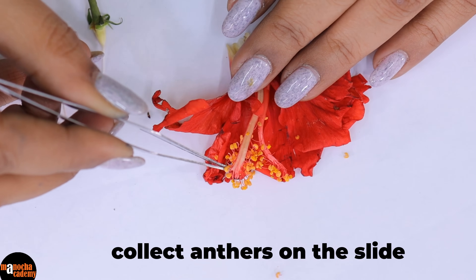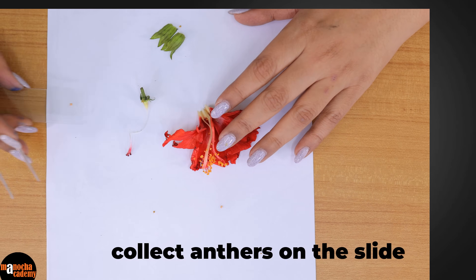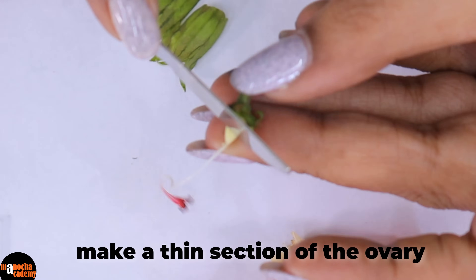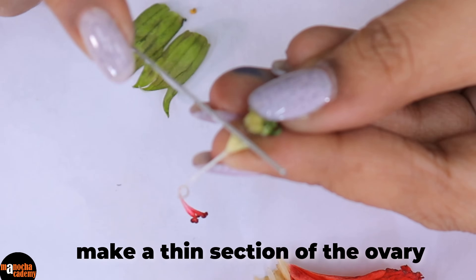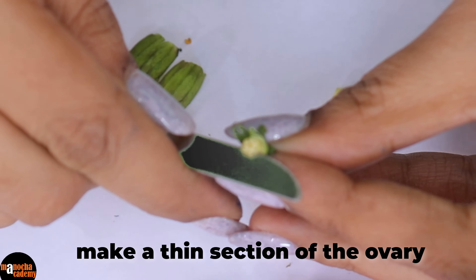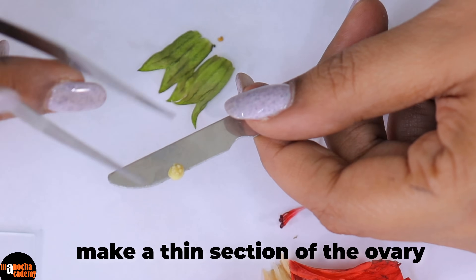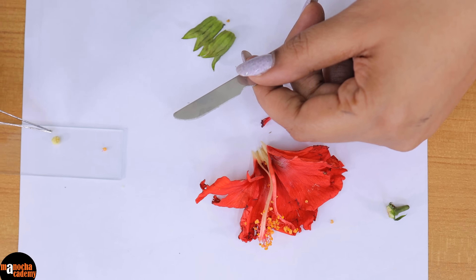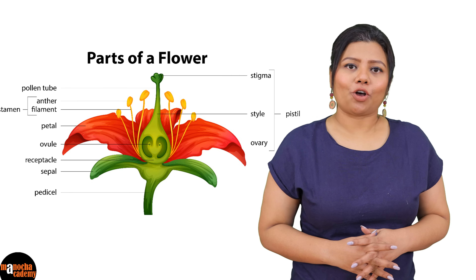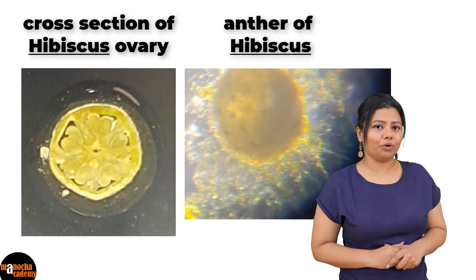So we are going to take one or two anthers, put them on the slide, and we are going to try and make a thin section — as thin as possible — of the ovary. You can see I made a section of the ovary and I am going to put it on the slide and we will just observe it under the microscope. This is how we dissect a hibiscus to see the different parts of the flower, and this is how the section of the ovary and the anther lobe will look under a microscope.